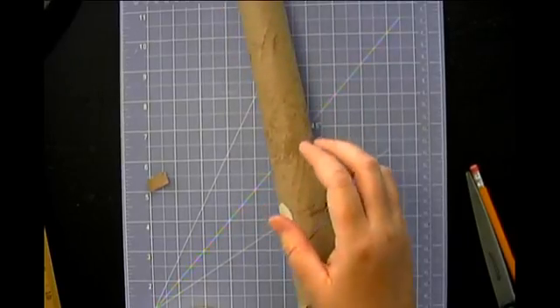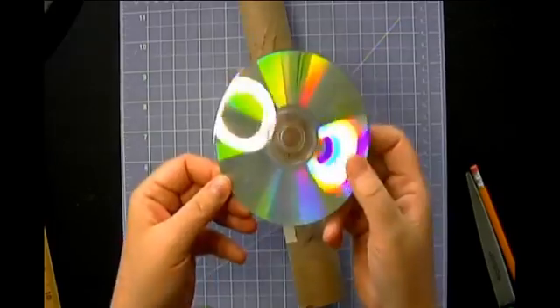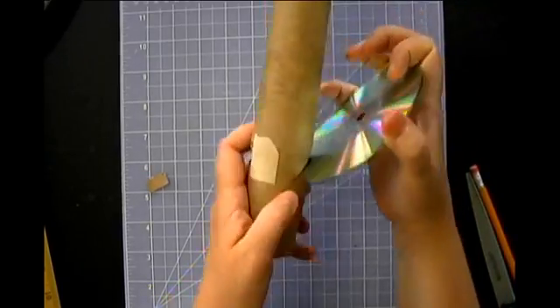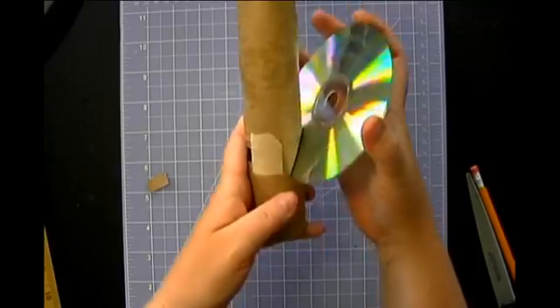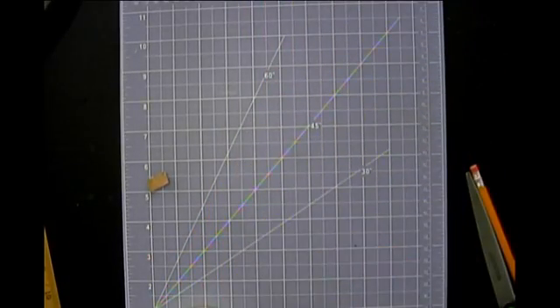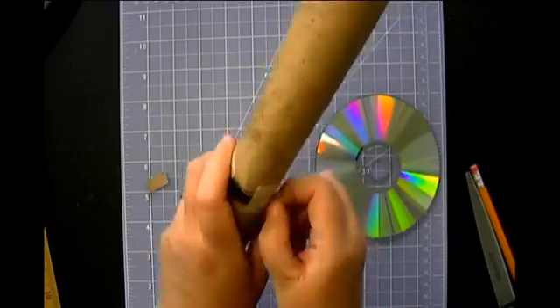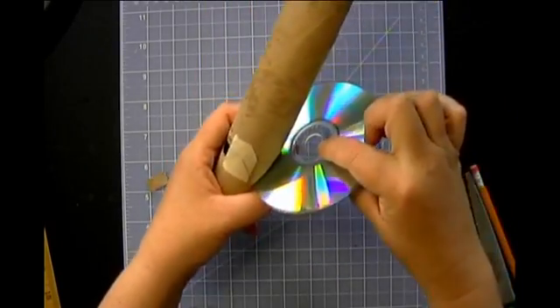Now I'm going to grab my CD, and again, make sure that it's clean. Make sure it doesn't have too many scratches. Mine has a couple scratches, but it's still reflecting very well. It's still refracting well. I'm just going to go ahead and insert my CD right on into that slit. And I'm going to take a quick look and see. I'm going to look through the hole and make sure, am I looking at my CD? Yes, I am. At this point, you may decide that you want to cut your slit a little bit deeper if you want to get your CD in there a bit more. You just want to remember that you don't want to end up looking at the hole in the center of the CD.